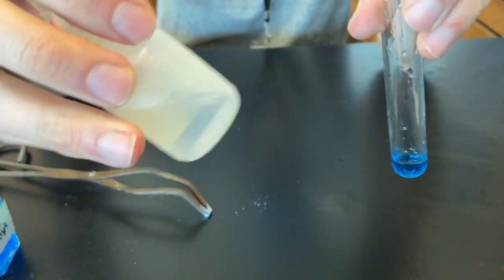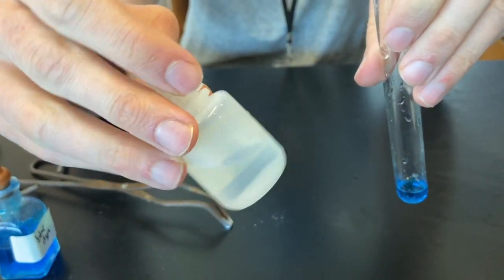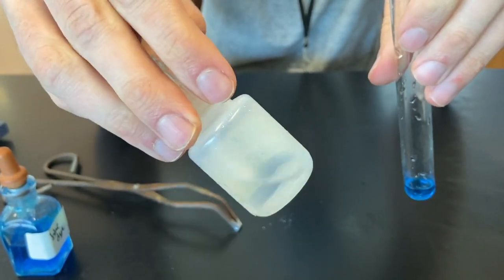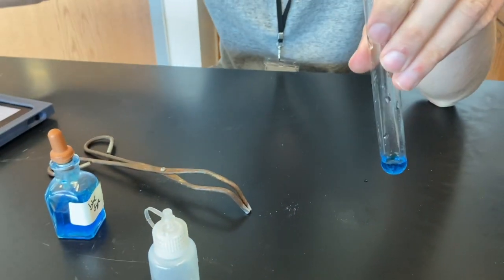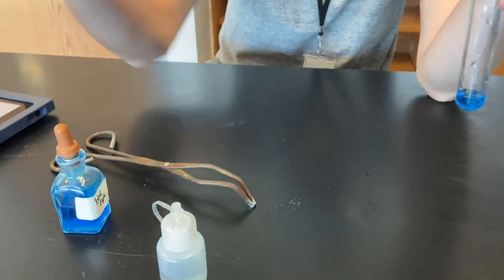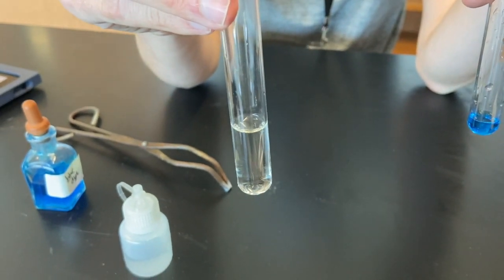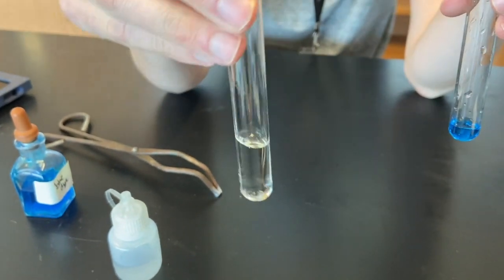Here is the hydrochloric acid HCl. And then here is the sodium hypochlorite. Now you should be making your pre-observations on all three of these substances—quick observations on them.